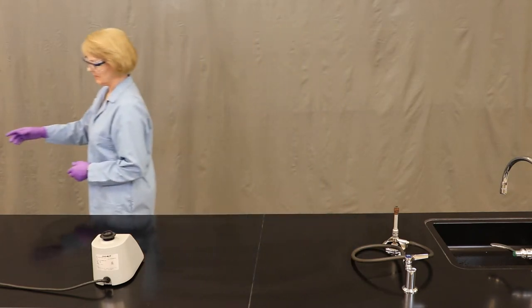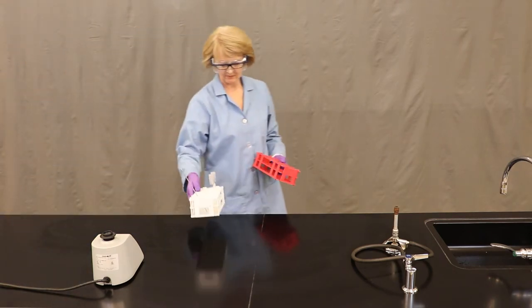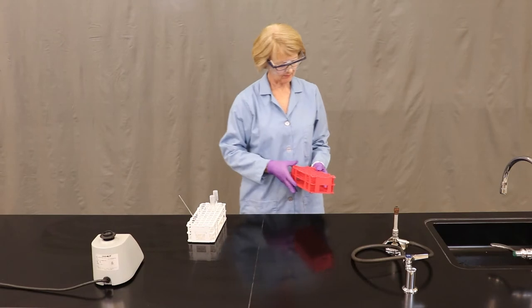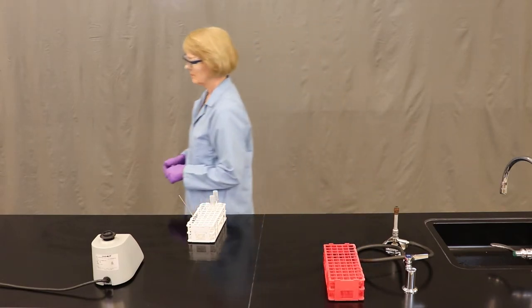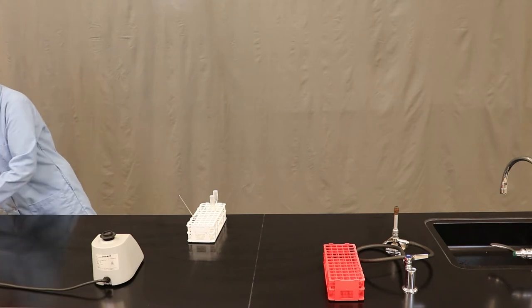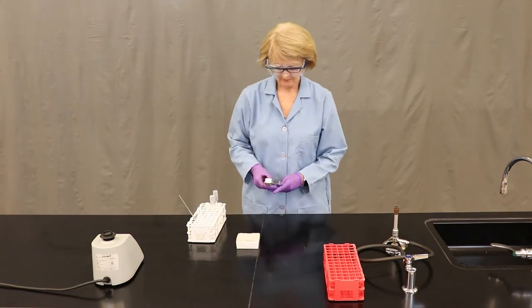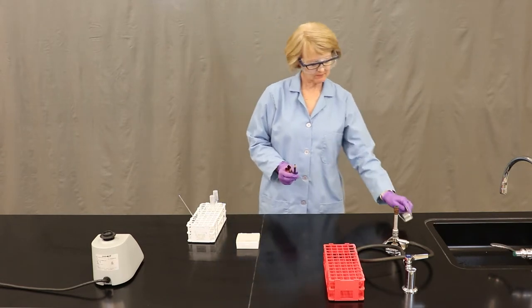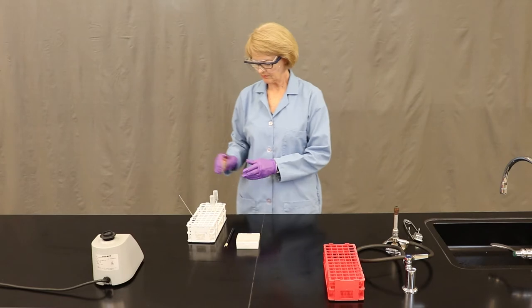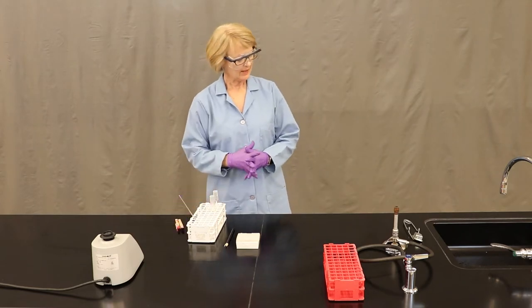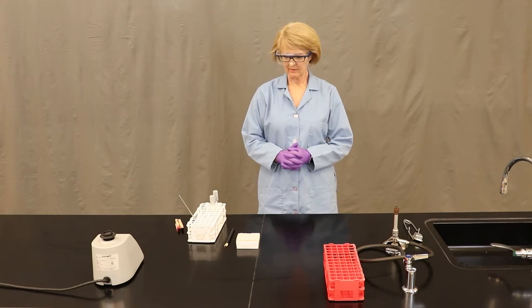Now you're ready to collect all of the items you need to create your smear. We're going to have a test tube rack containing our bacterial cultures, a disposal rack when finished. You're also going to need glass slides, a striker for the Bunsen burner, a wax pencil, you may want your clothespins on hand, and last but not least, you're going to need your metal inoculating loops.